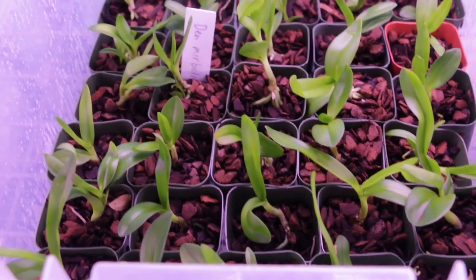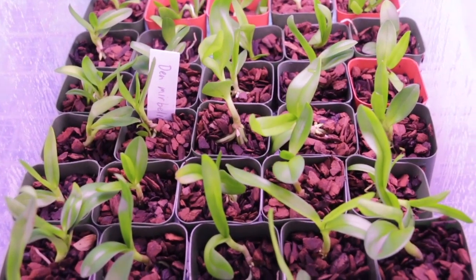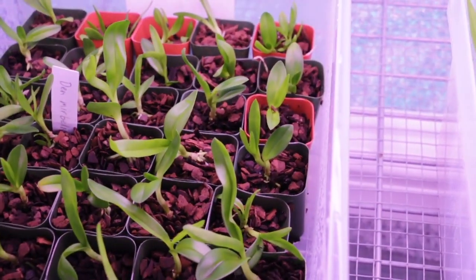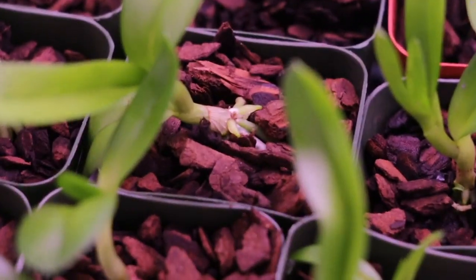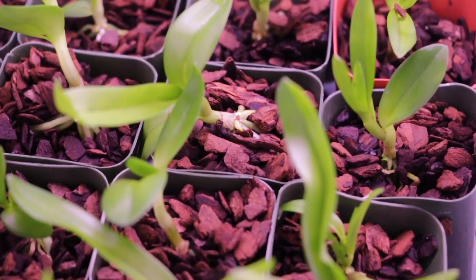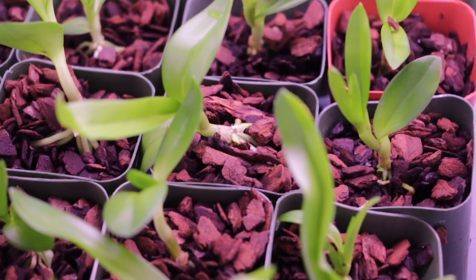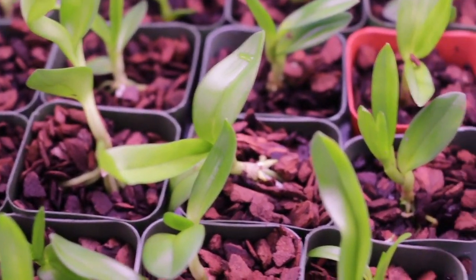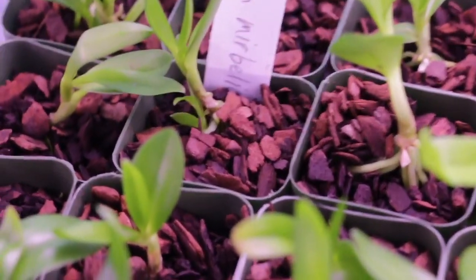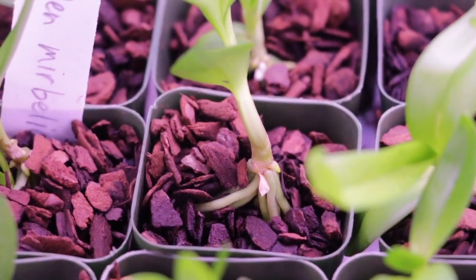The thing that I noted about what he did when he deflasked these plants is he planted them a little bit too deep. I like planting them where the roots come out of the stem, right at the crown, right at the level of where the bark is, so right here. And the reason I like having it there is because you can see what's happening. Root growth and the induction of new roots is kind of an indication of orchid health. And what I like doing is seeing if there's any new roots coming out of here, and if they're at this level, you can see that, yeah, okay, this is right, and they're doing well.